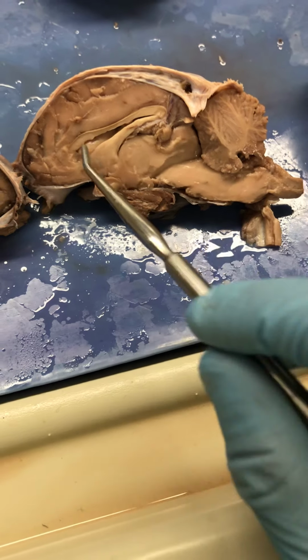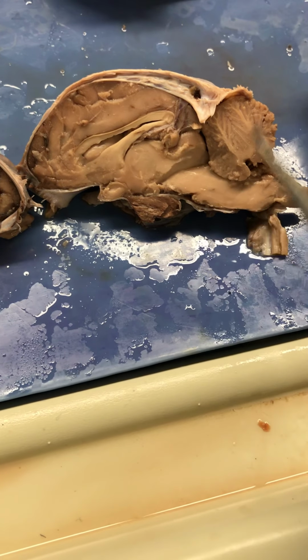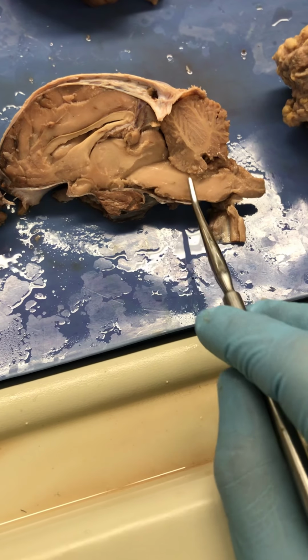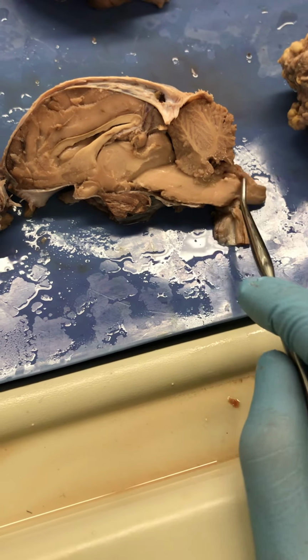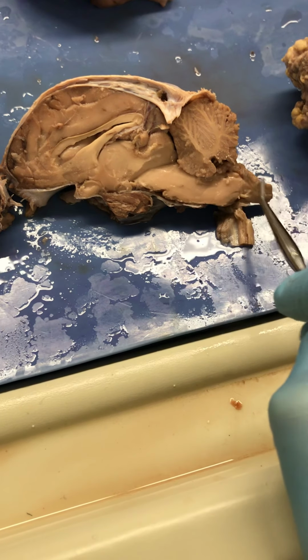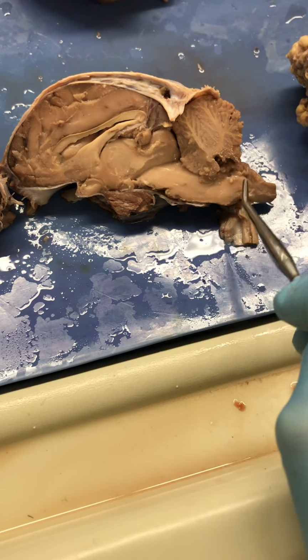the pons will help to bring things. There will be cerebellar peduncles, all kinds of stuff in this area, okay? And then this is the medulla oblongata, everybody's favorite, and it stops. So remember, the spinal cord is here. This is where the spinal cord starts. We want the medulla oblongata to stay in the brain.